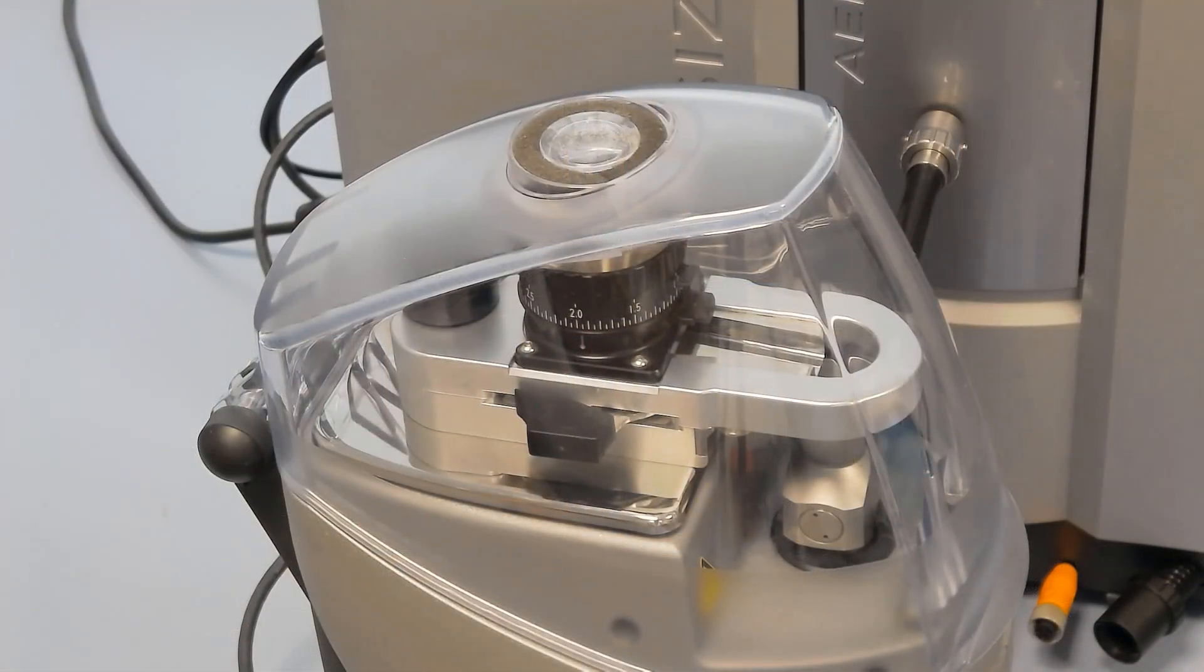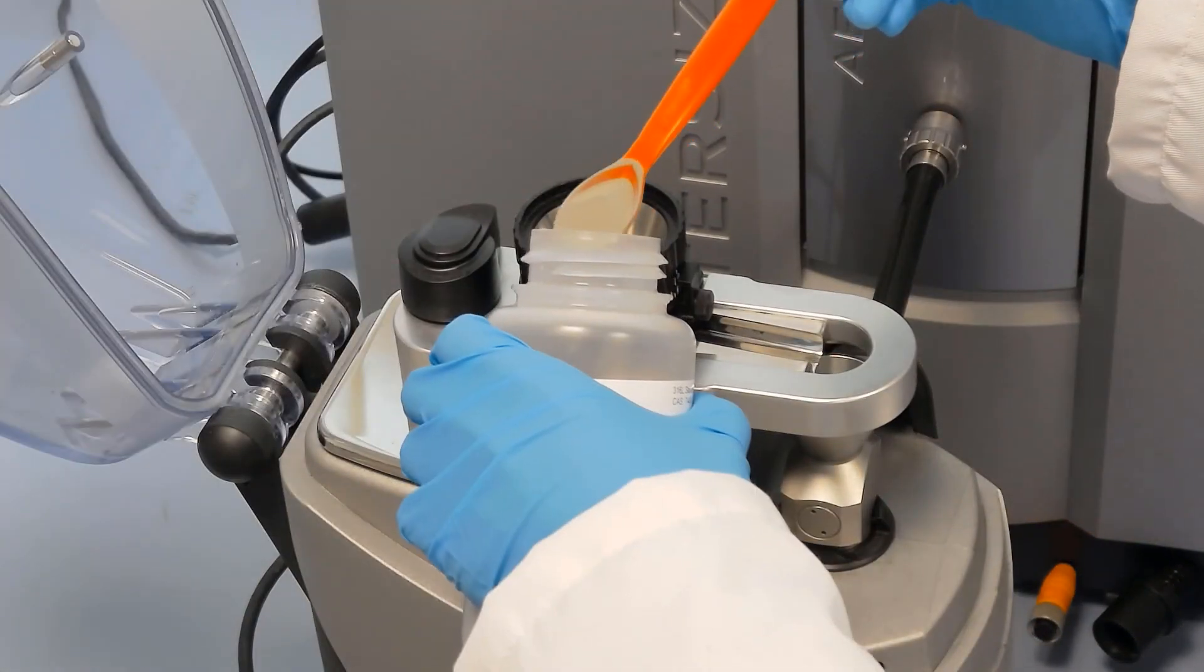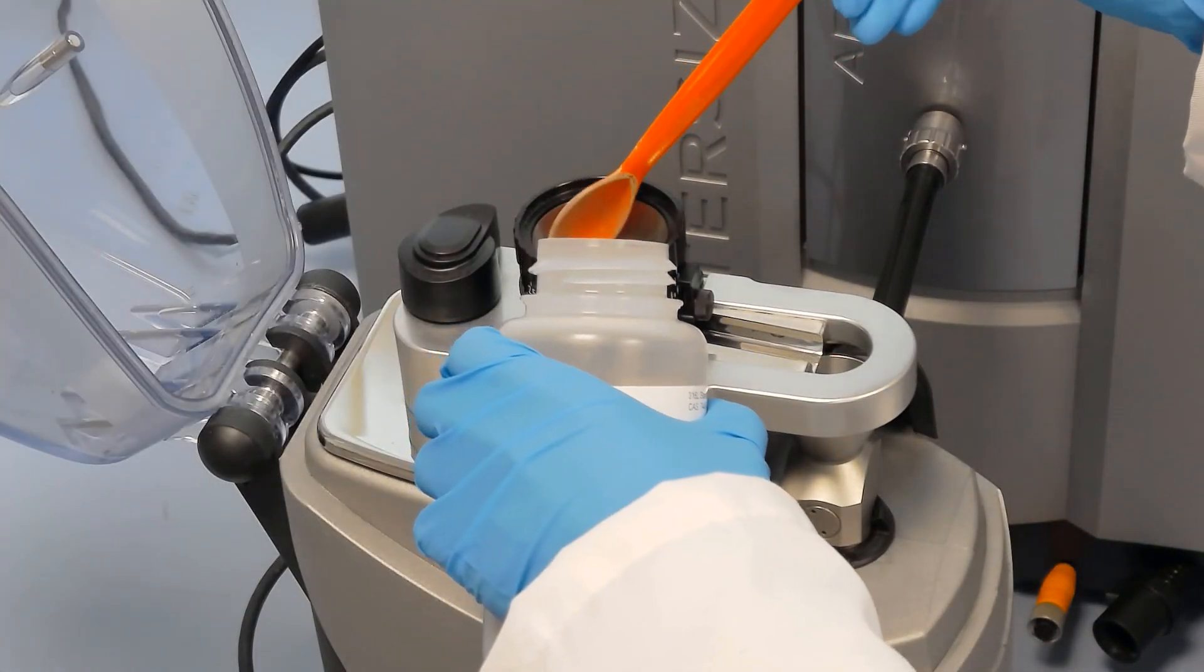First, for dry measurements, we can safely load our sample into the Aero S, which has a lid to protect users from any dust that might be produced during the measurement.